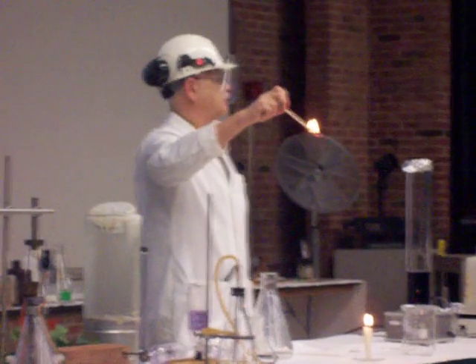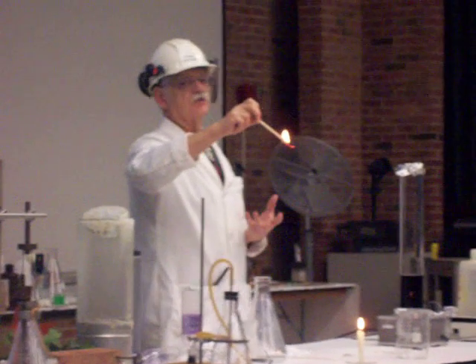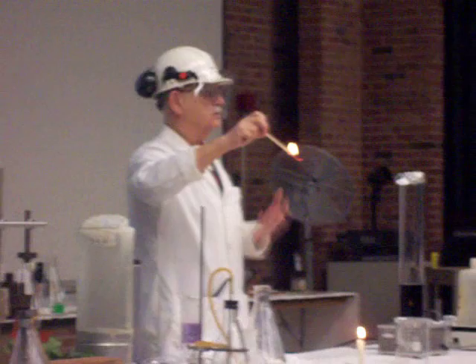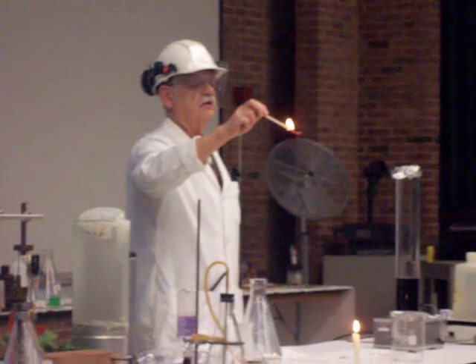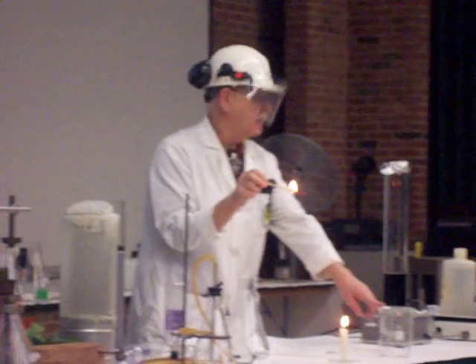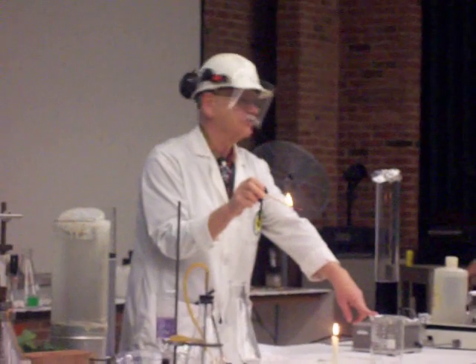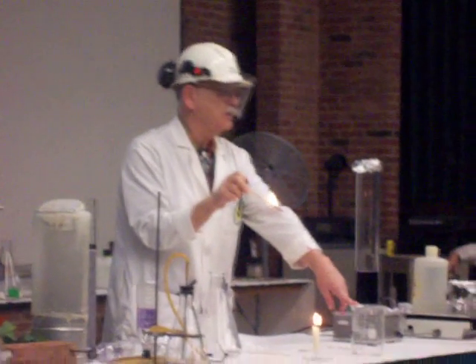In this case, the carbon in the wood reacts with the oxygen in the air. We get carbon dioxide, water vapor, and ash. You may have noticed that I put a few pieces of dry ice into this beaker.